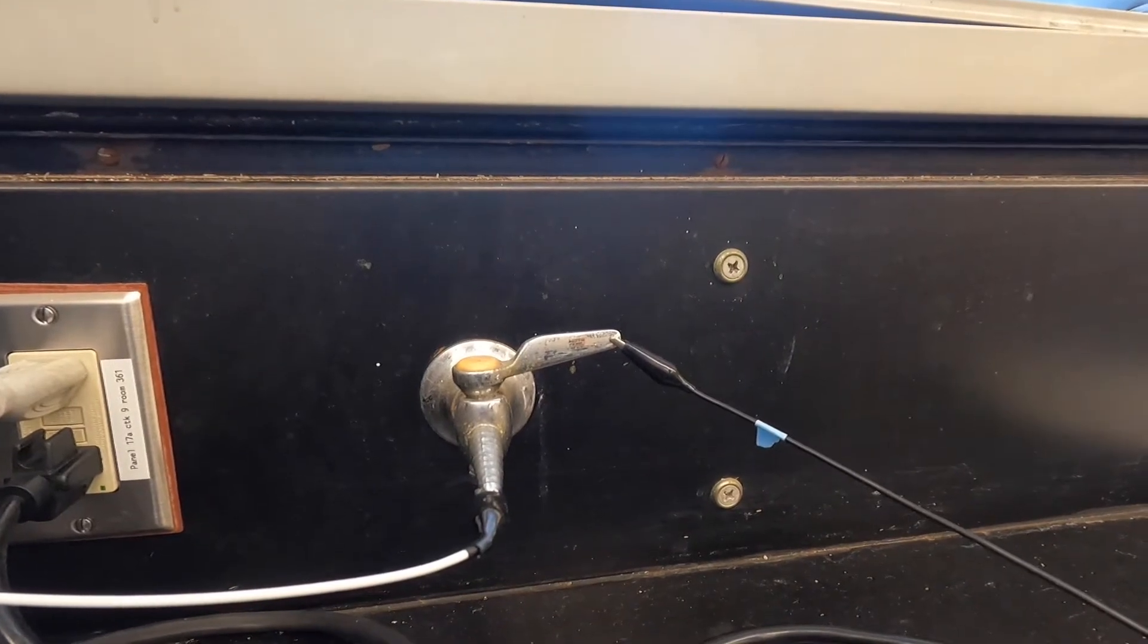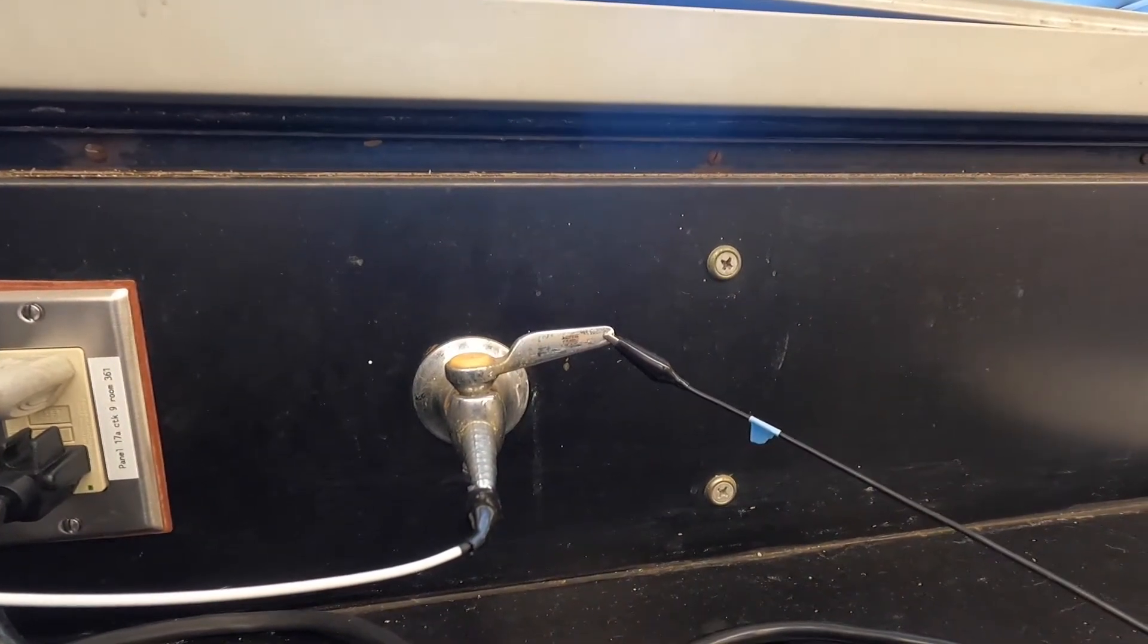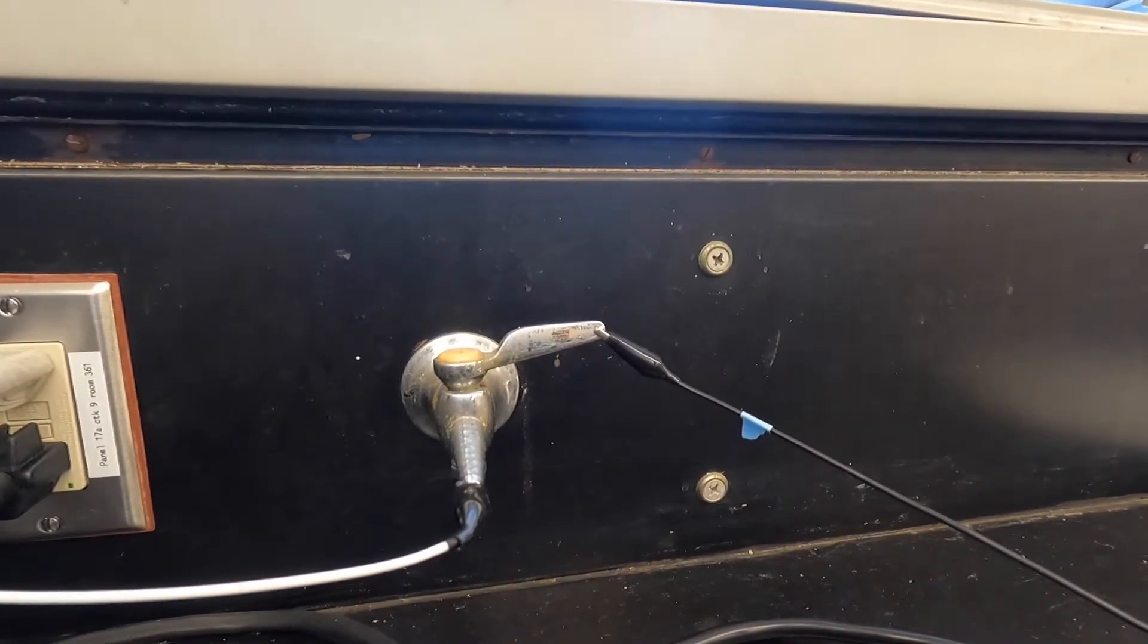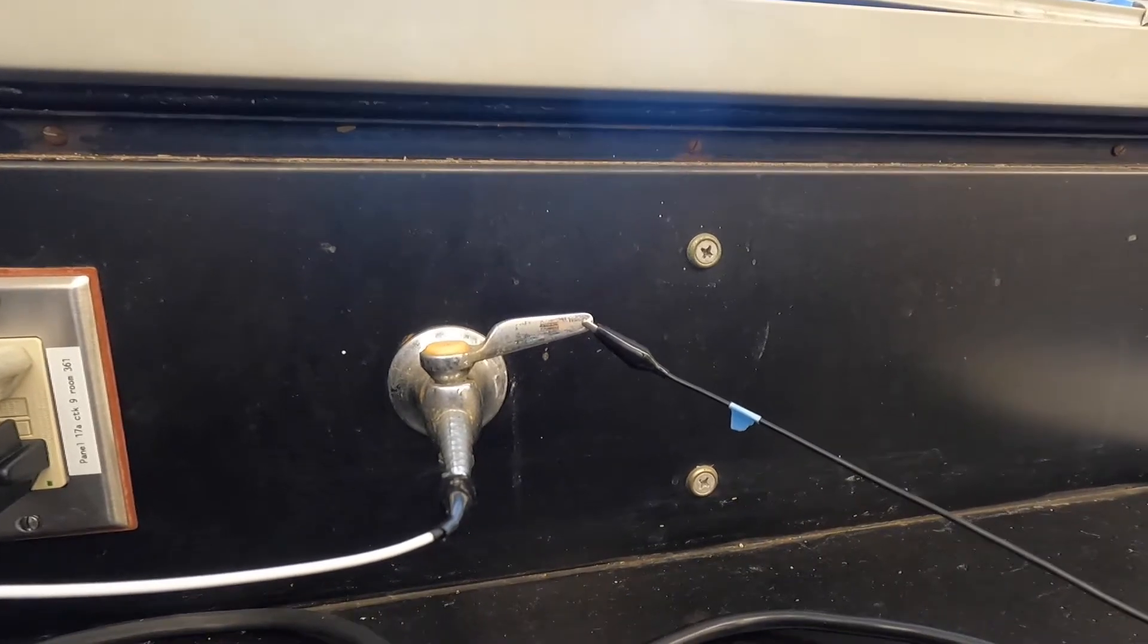Make sure you also connect the ground wire coming out of the back of the Gamry to anything that is connected to the plumbing.